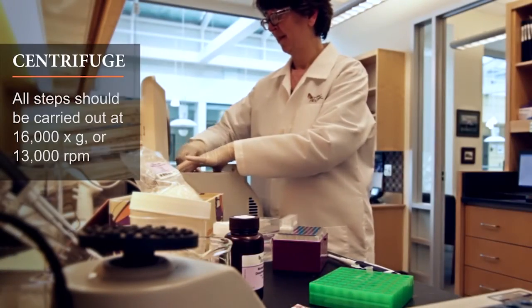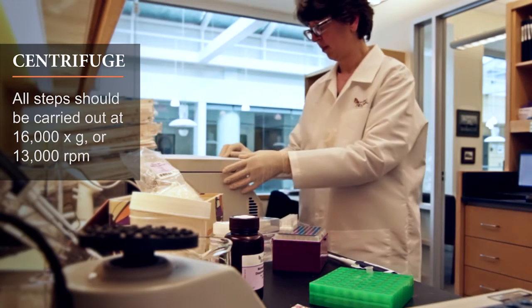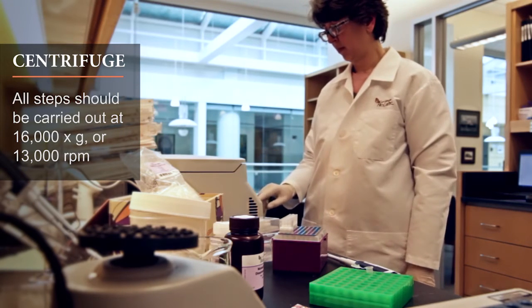All centrifugation steps should be carried out at 16,000 g or approximately 13,000 rpm.